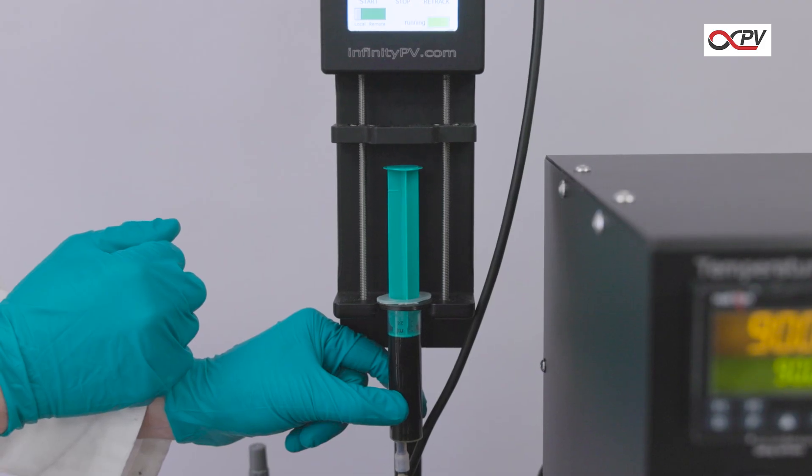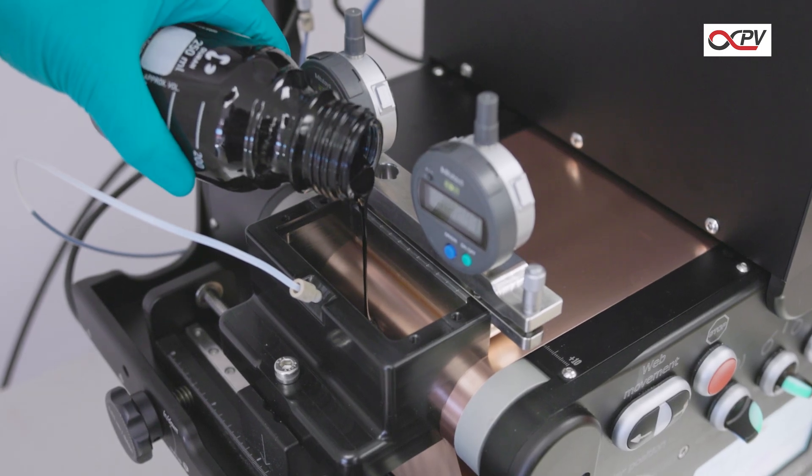Depending on your setup, you can also pour the material directly into the coater's integrated reservoir.